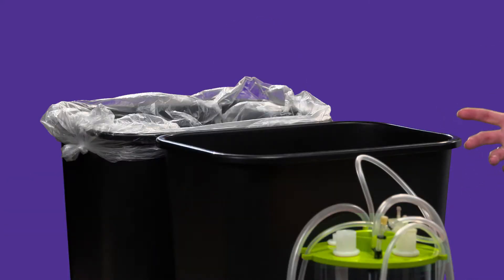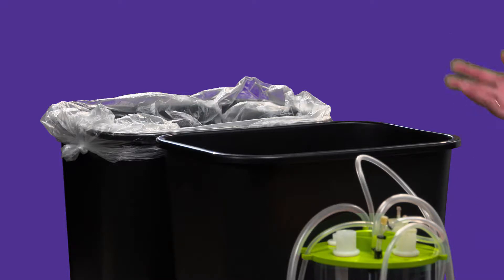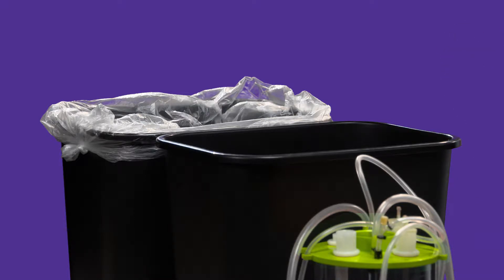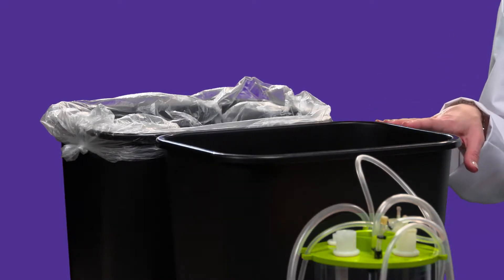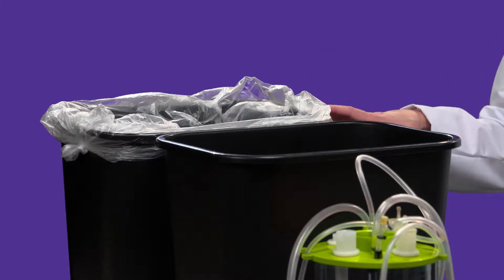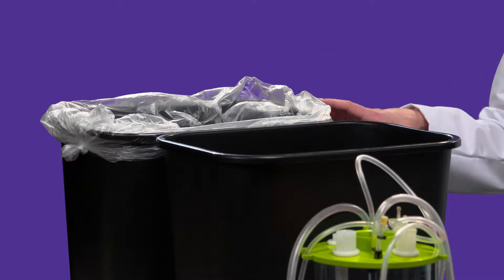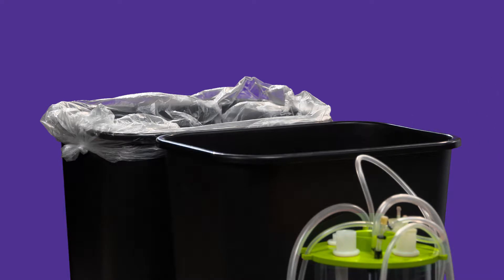I'm going to start with a real-world analogy using these two garbage cans right here. Everyone at home hopefully has a garbage can that they use in their household. You throw a variety of things in this garbage can — you're throwing some liquids, some solids, maybe coffee grinds, a dirty diaper — a lot of disgusting things go in here before it gets filled up.